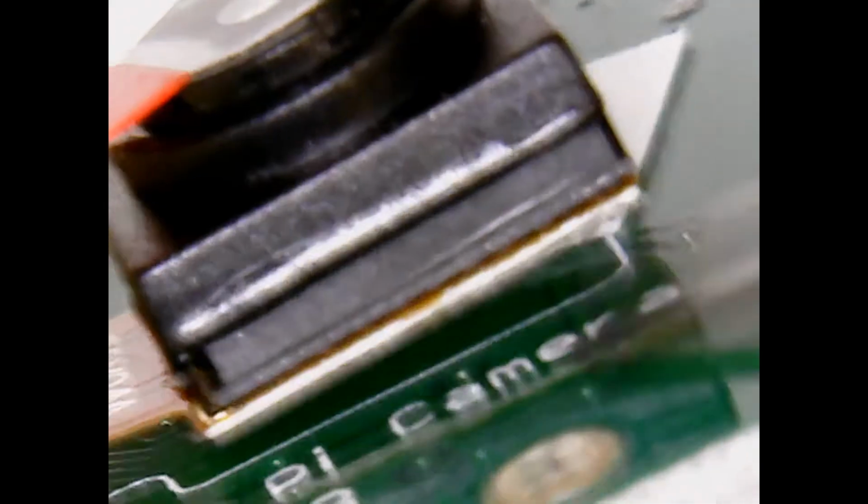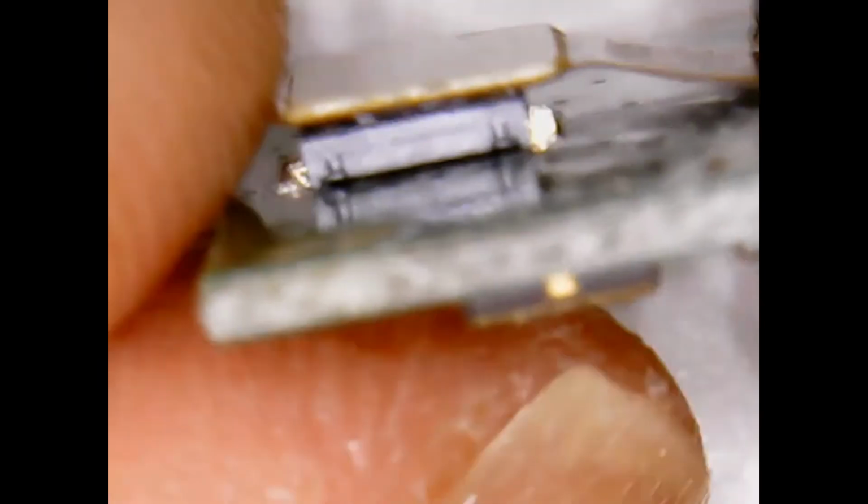I'm holding down on the cable, push it down, and I'm just going to push the camera straight down wherever it wants to fall. So that's going to act like a strain relief. So I'm pushing it firmly. So now it's double sticked and the connector's there. Everything's good, okay? Now there's a little tab here which protects the lens, but we're going to be chopping the lens off, so you can leave it on. I like to save the lens, you know. Someday you'll use it for something.